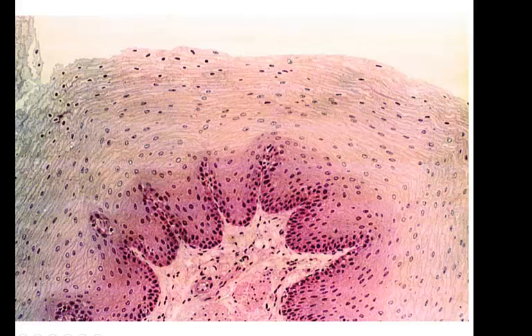This is our stratified squamous epithelium, and it goes from here all the way down. And then this is our underlying connective tissue. This would be our areolar connective tissue. This would be the lamina propria, the areolar connective tissue. So here's our stratified squamous, and the reason we know that this is stratified squamous, when you have stratified layers, down here these cells look quite cuboidal, but you look at the top layer and you see how flattened these cells are.